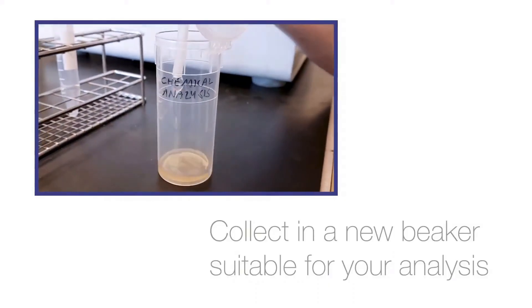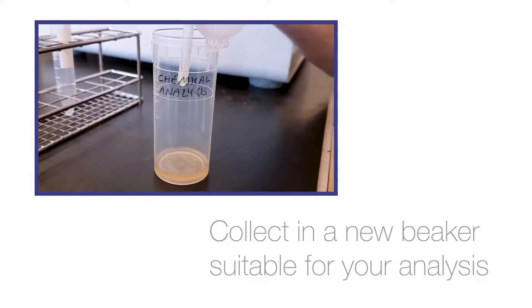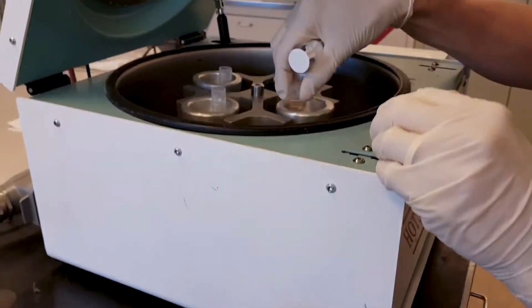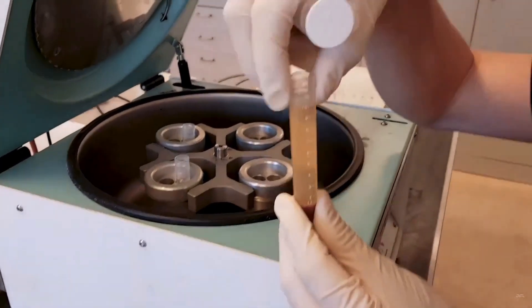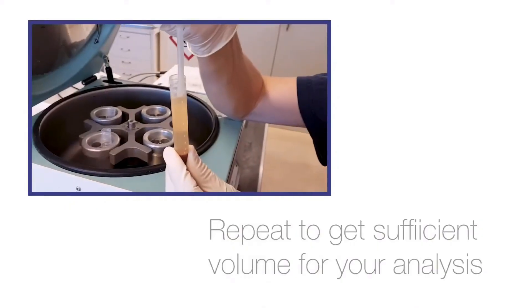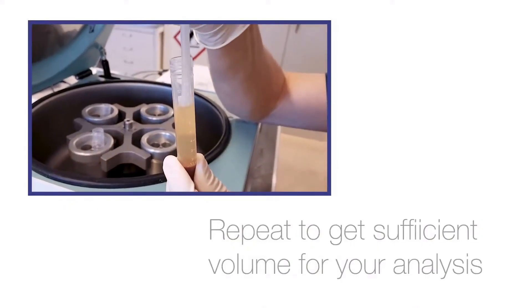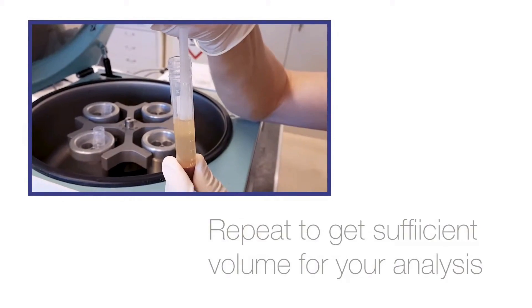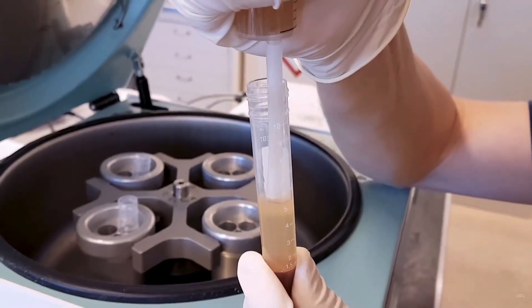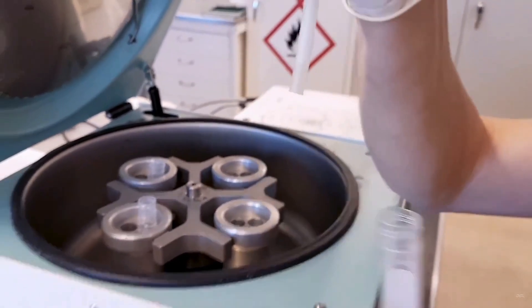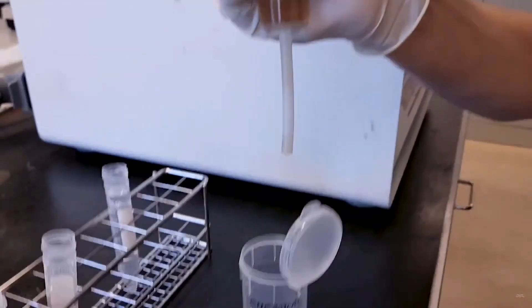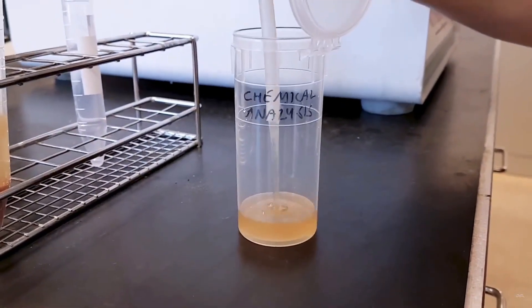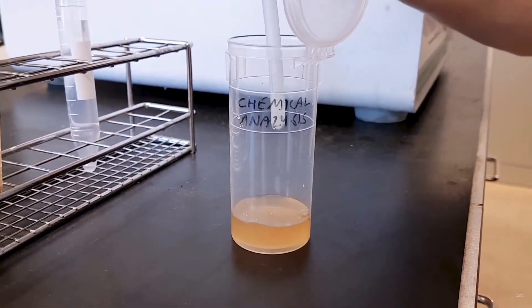You will then repeat the same operation for the second vial. Also in this case you need to remember to sample close to the liquid surface lowering the syringe while sampling. 10 milliliters are required for the analysis but you can take only 5 milliliters per vial. That's why you will use the second vial in order to reach the required quantity.